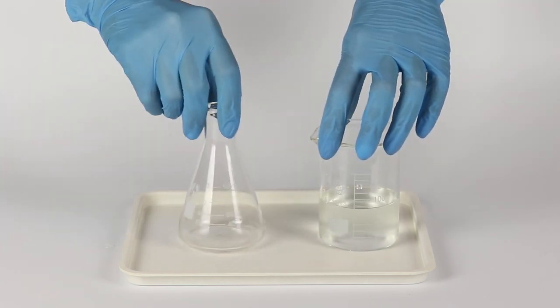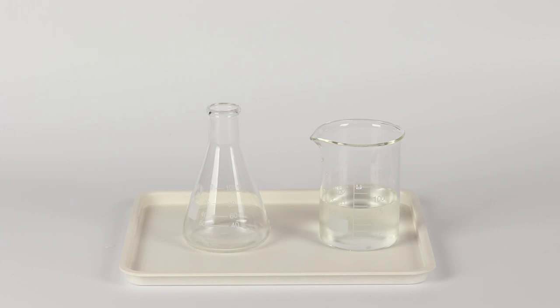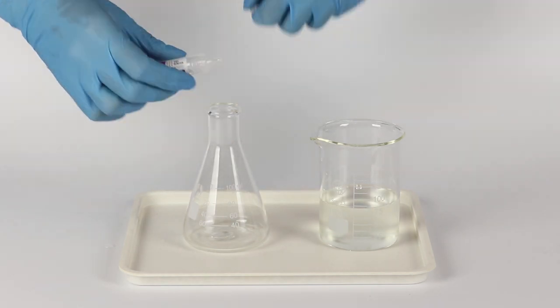Prepare the second solution containing the oxidant, hydrogen peroxide. Take the flask. Measure 10 drops of sodium hydrogen sulfate solution. Add the bottle of hydrogen peroxide solution.